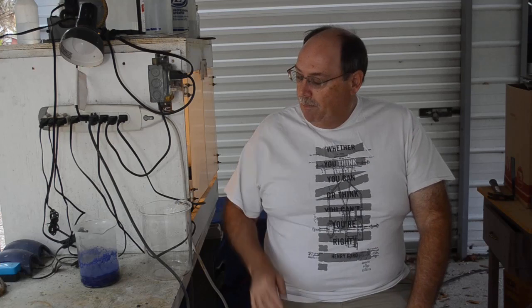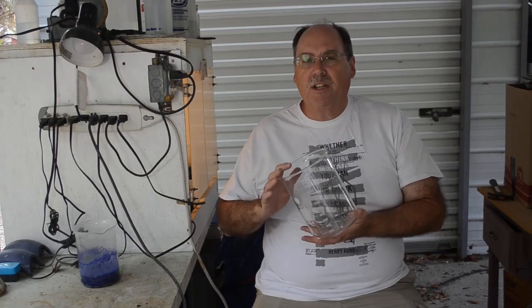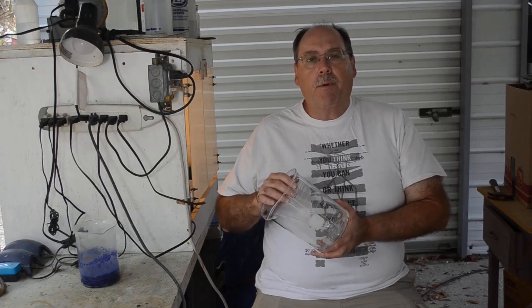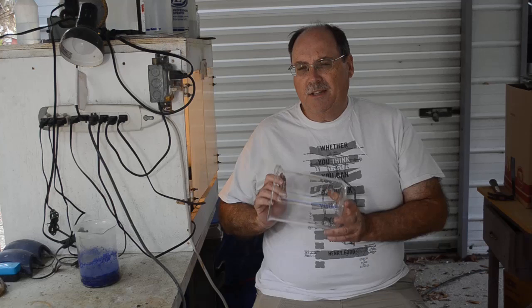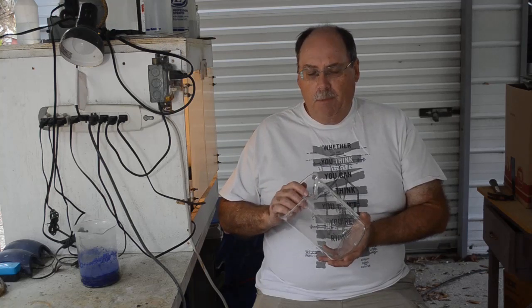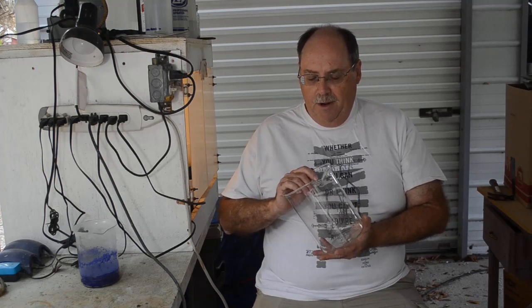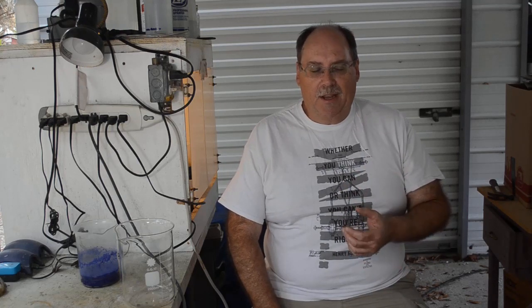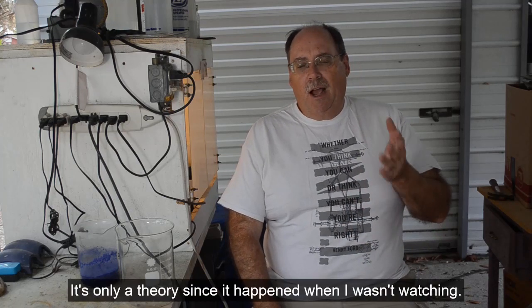Alright, well that was an interesting result. And, by the way, I did get my beaker clean. Fortunately, that black tar-y stuff, whatever it was, was mostly water-soluble. So, it came right out of there. I have a theory about what might have happened. I did use urea to denox the stuff before I cemented the silver out of it. So, I'm wondering if, it looked like that black stuff looked like there was something organic in there. So, I imagine, my theory about what happened was, as the liquid got more concentrated, the ferric nitrate in there broke down, released a lot of nitrogen dioxide, energetically. It probably had a little bit of a thermal runaway. It reacted with the urea and created that tar-y stuff. Probably drove the thermal runaway faster because it's organic in there and there's carbon and hydrogen. That's my theory.